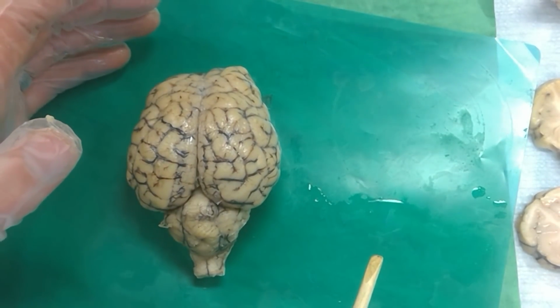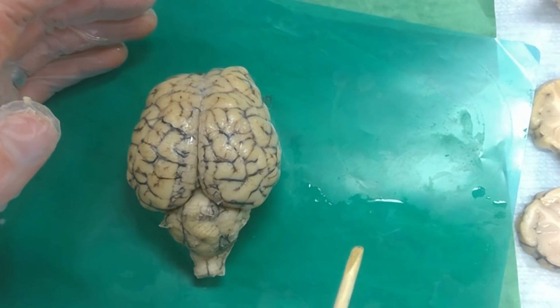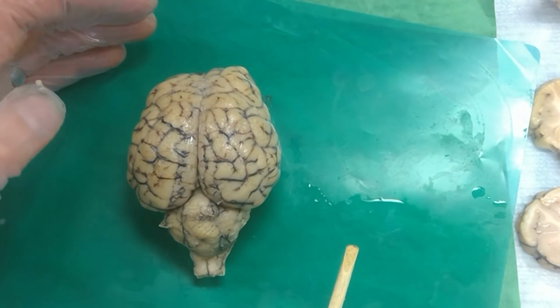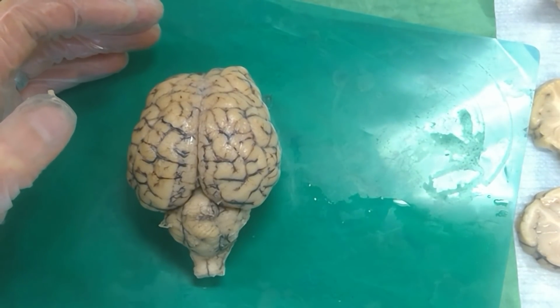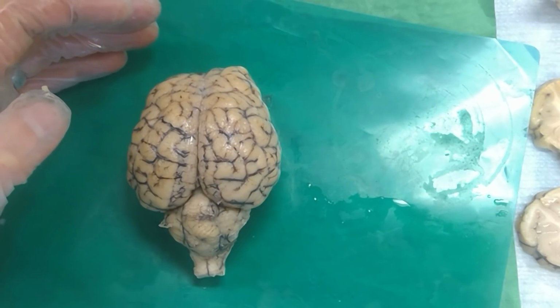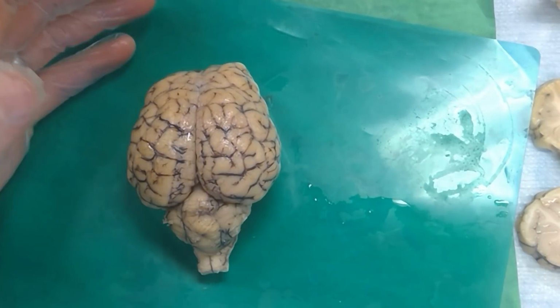And could you also show the choroid plexus on this? I wouldn't do the choroid plexus on this. I do it on a sagittal or a coronal cut. Yeah, it's on the list, I just didn't think we had talked about it. It's inside the ventricles, so I feel like it's kind of hard. There might be some sticking out of the fourth ventricle, but otherwise it's, yeah.